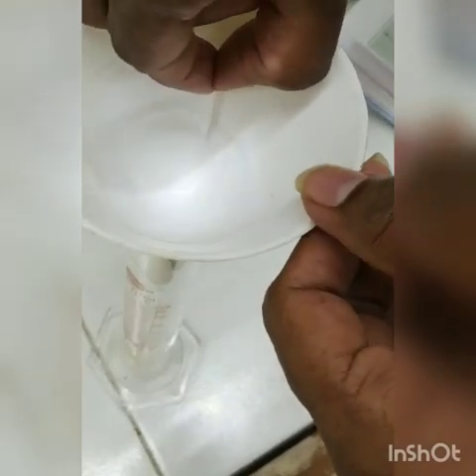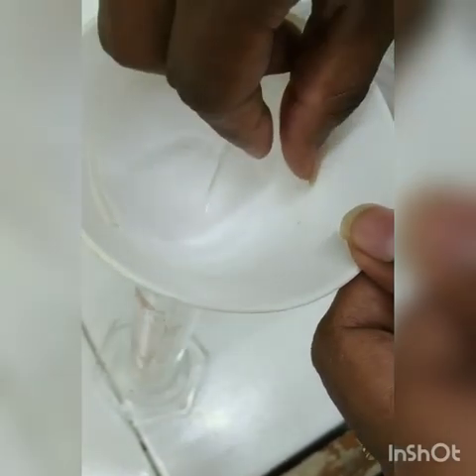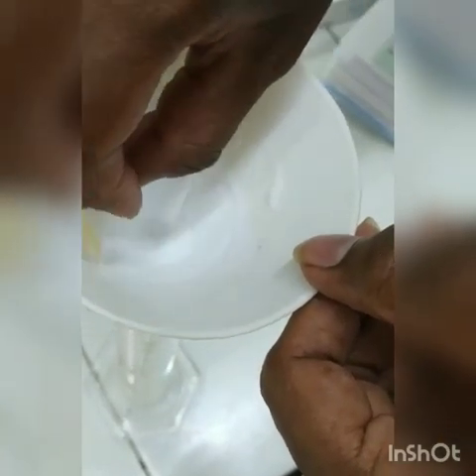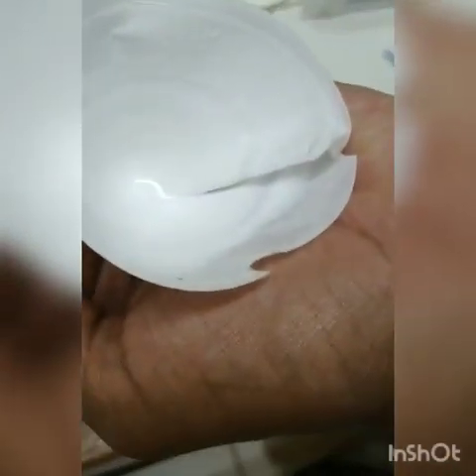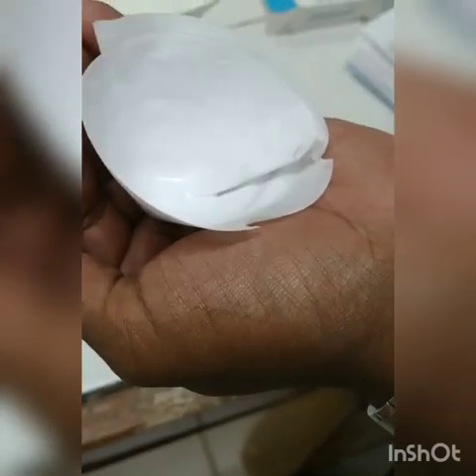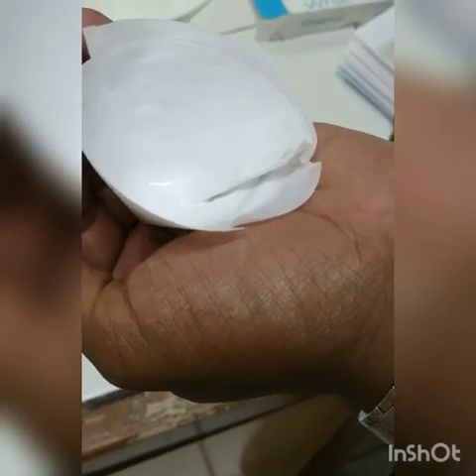Okay, so what we can do is take this filter paper and slowly dry it to determine the area occupied by the filter cake. For that you need to dry it in a hot air oven. Carefully lift this filter medium to show. You can see the filter cake. So after carefully unfolding it, dry it, and then see how much area is being utilized for the filtration process to measure the surface area of the filter medium.